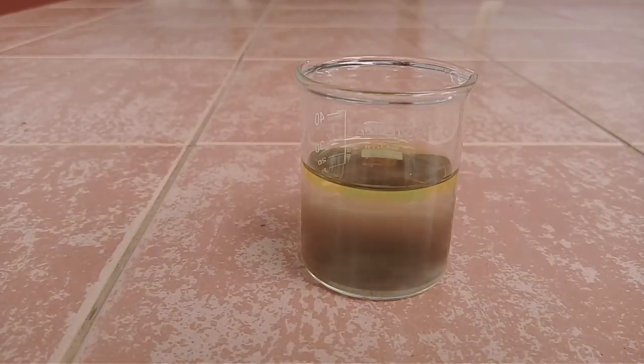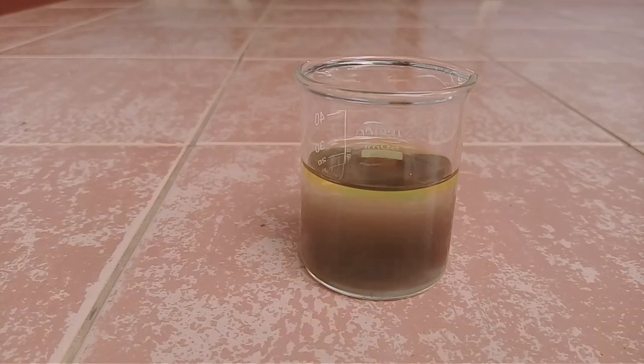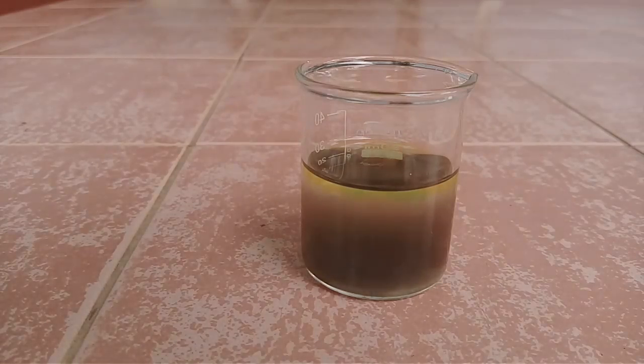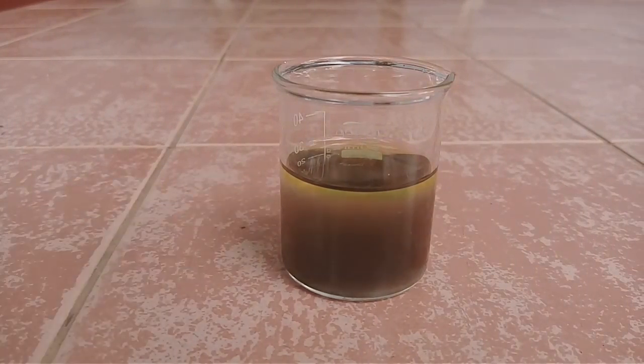Now you can see here the color is changing. The solution is dark brown color now. Actually this is gold particles.